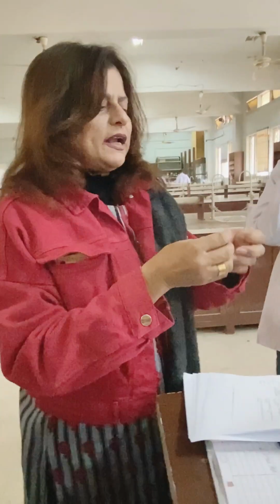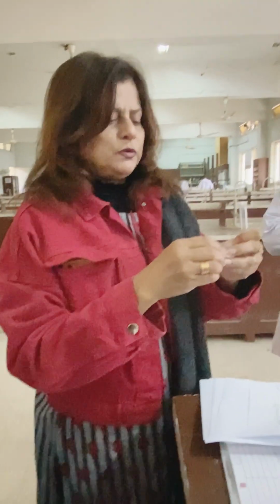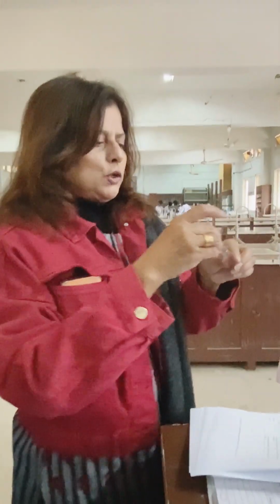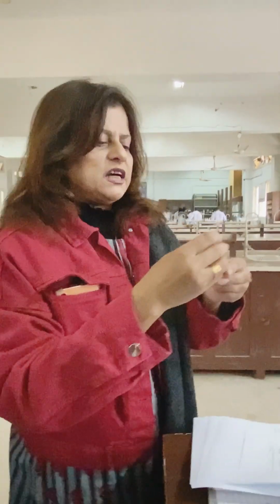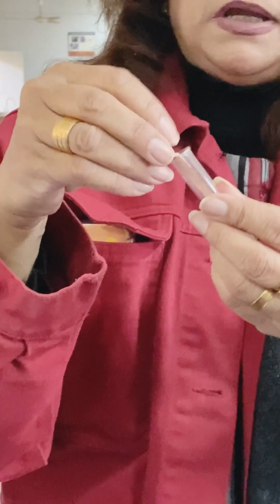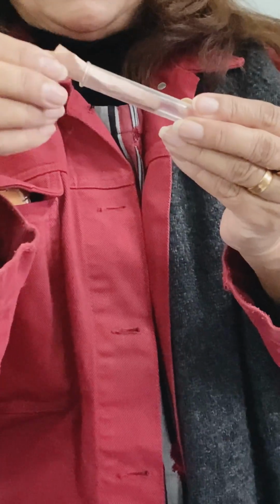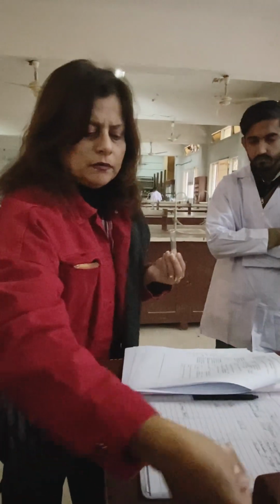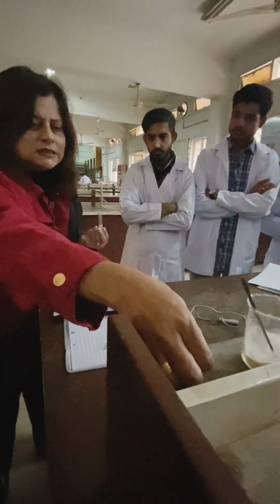Chalo. If, for example, this is your litmus paper, right? Good. Now what you are going to do, when you have that compound that is dissolved totally, you will just simply insert this litmus paper inside this, and it should be immersed inside this solvent. You will tilt it a bit and let it be inside for a while, and then take it out and put it over here, right? And just see the color.